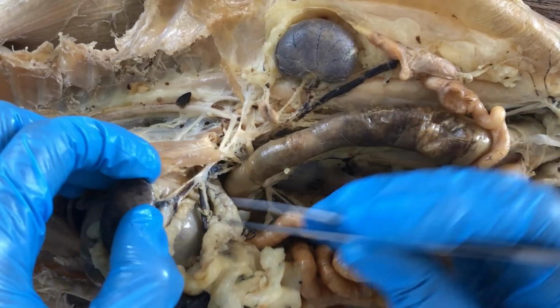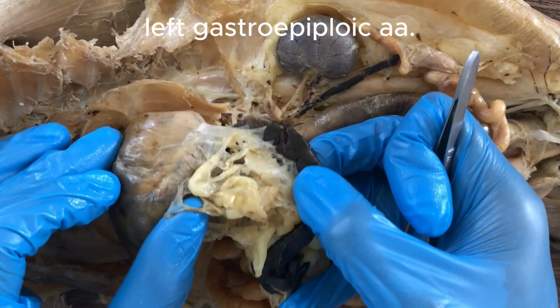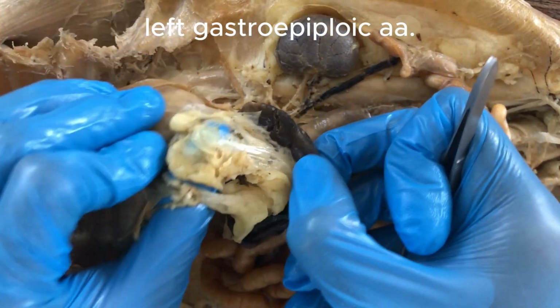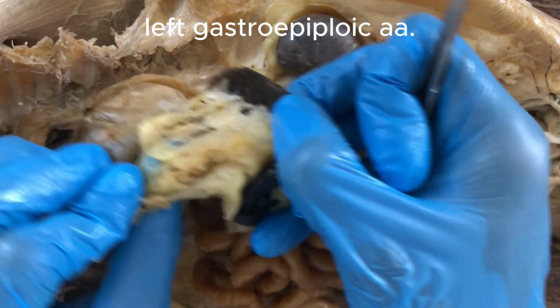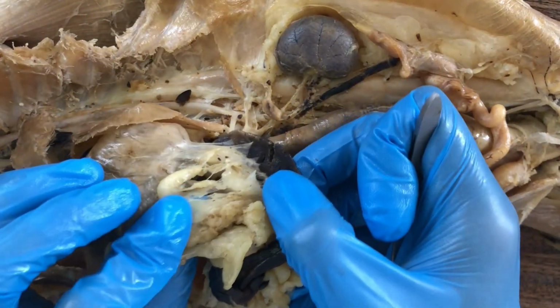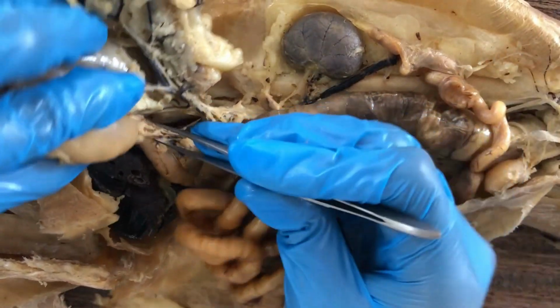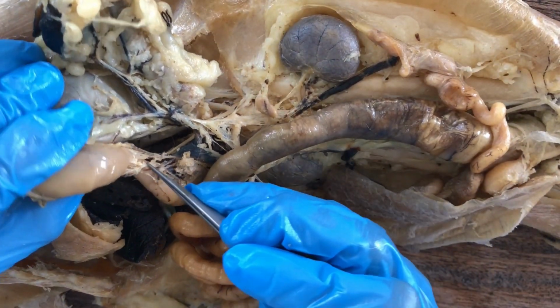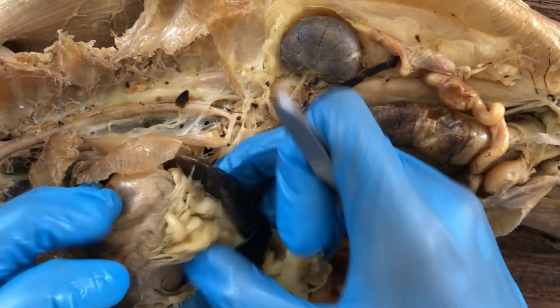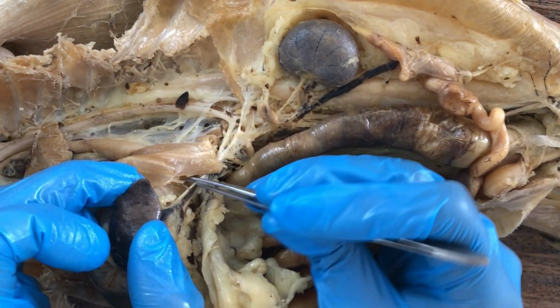And also coming from the anterior splenic artery are the left gastroepiploic arteries embedded inside the gastrosplenic ligament. So this is the gastrosplenic ligament. There will be veins and arteries there supplying blood to the greater curvature of the stomach. Those arteries are the left gastroepiploic arteries, different from the right gastroepiploic artery you've seen from the right side. So the left gastroepiploic arteries came from the anterior splenic artery.